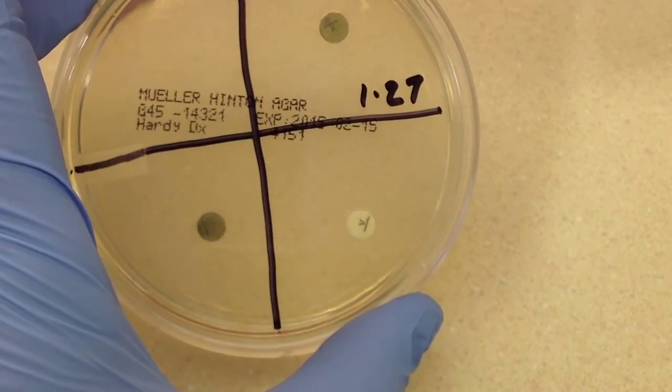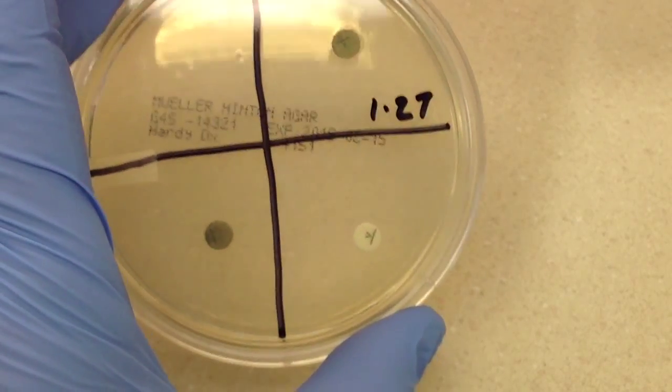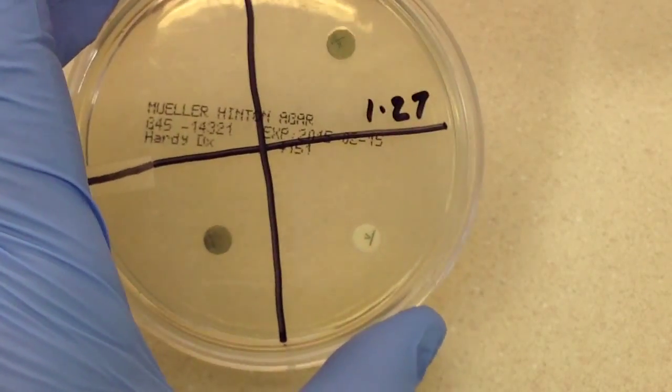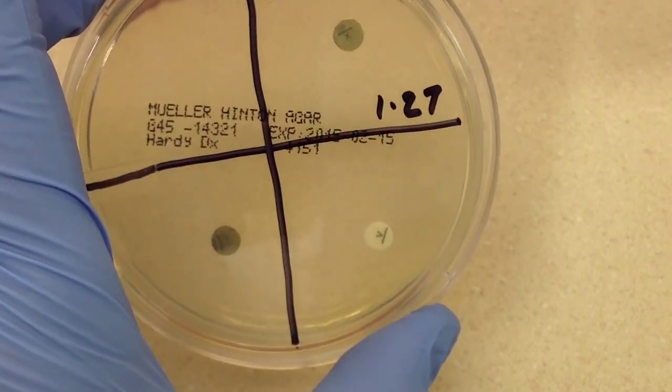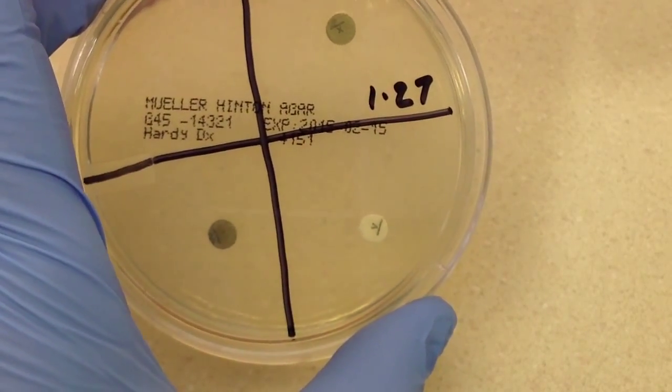And now one thing is that there probably won't be enough growth after 24 hours. I will check it, but we're probably going to need at least 48 hours to see any kind of detectable growth.